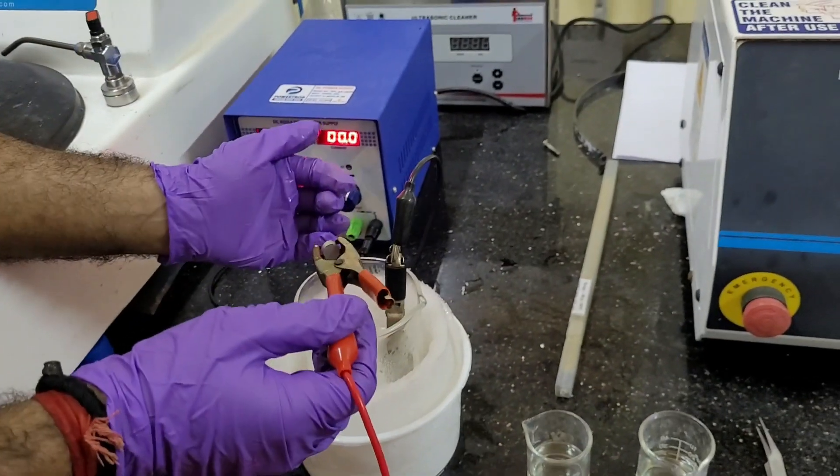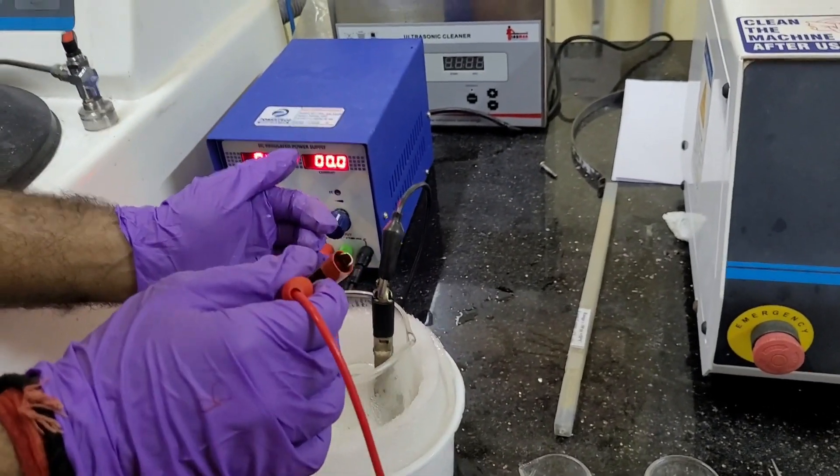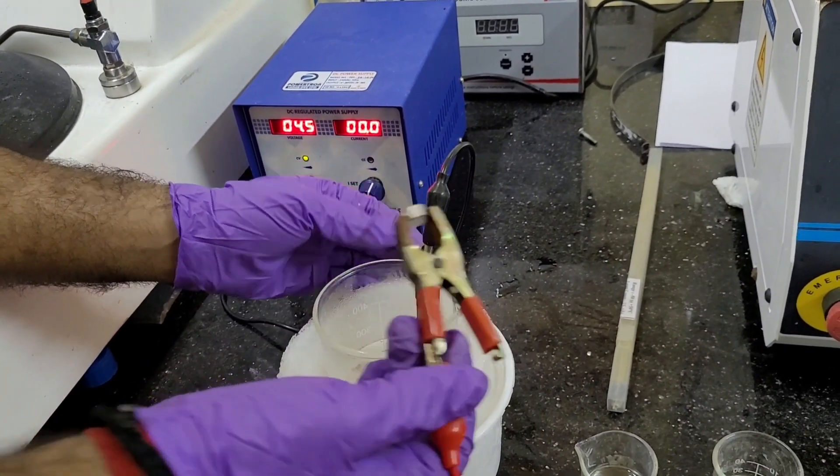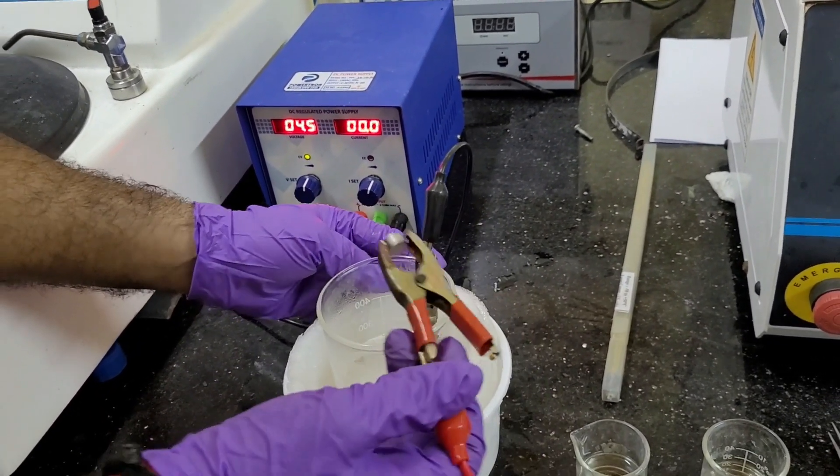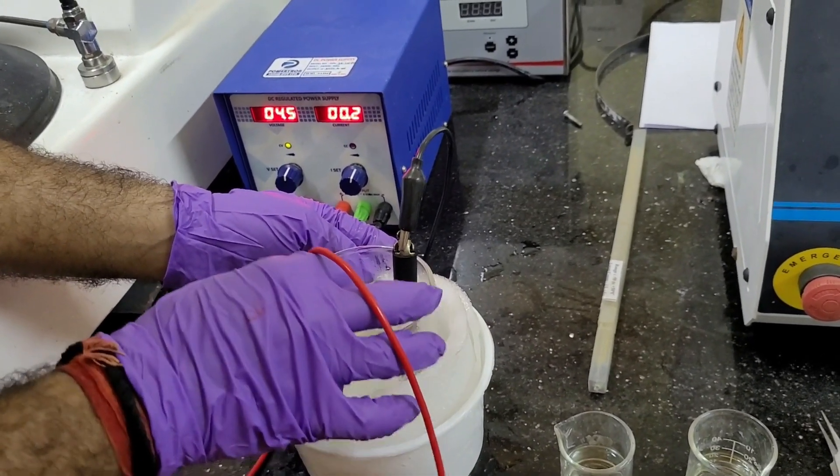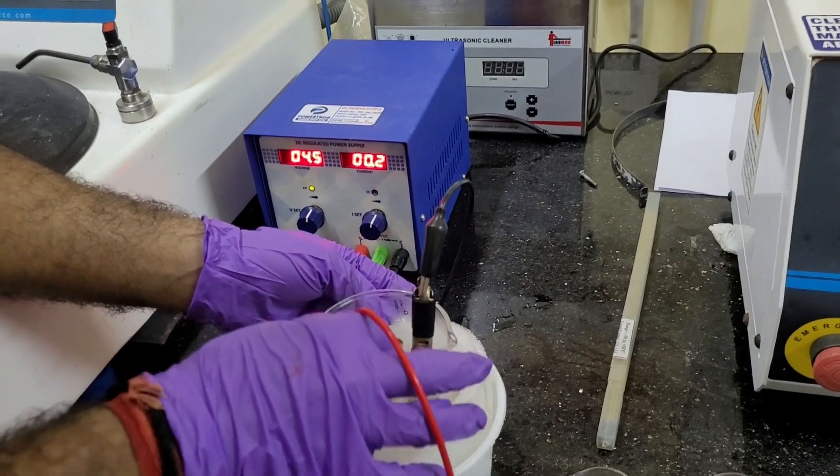So, we are going to start the electropolishing. And we are dipping this anodic made sample inside the electropolishing. So, my friend, you can start measuring the time, please. Goes. Stops.